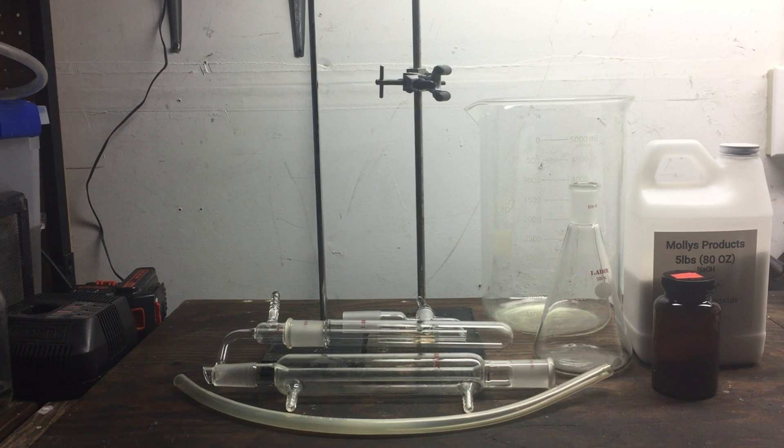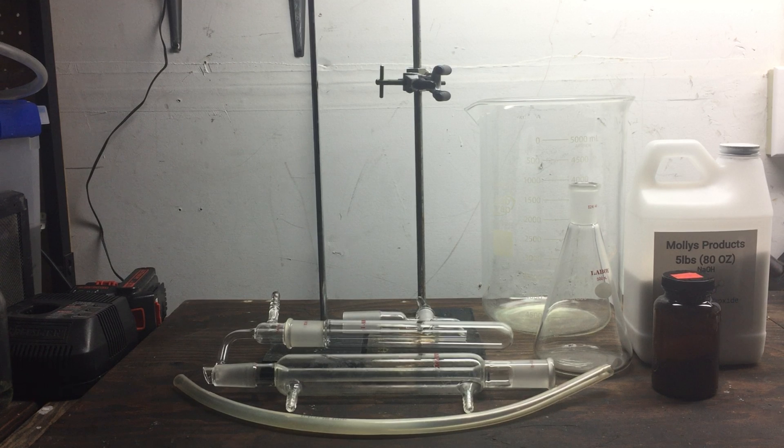Today, I will be demonstrating an ammonia gas generating apparatus that can be used to create a saturated solution of ammonium hydroxide. This will be an important reactant in some of my upcoming videos and I wanted to synthesize it myself.